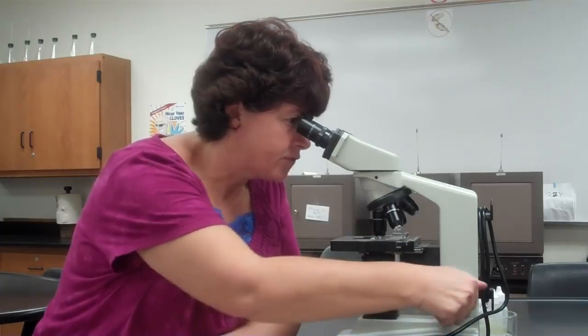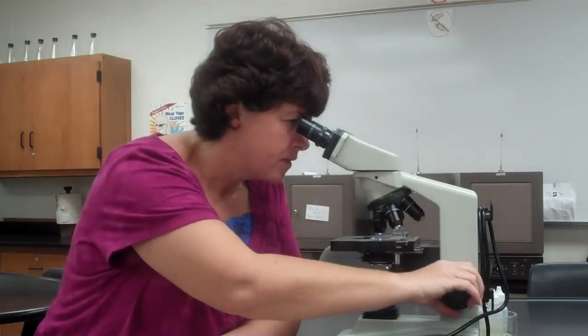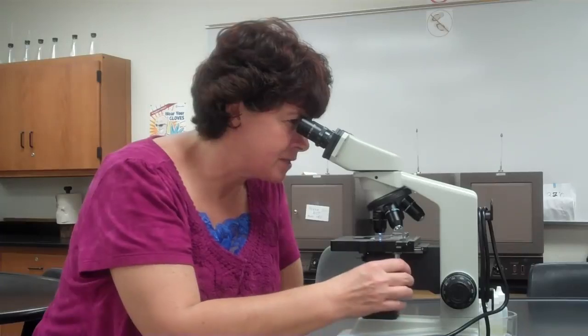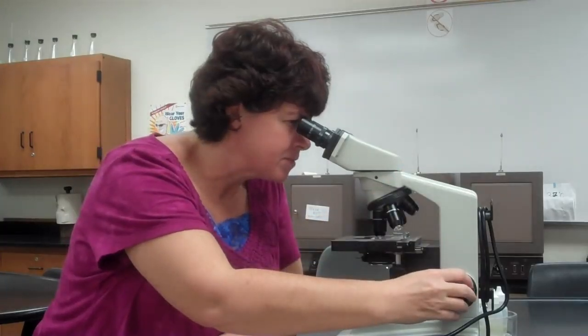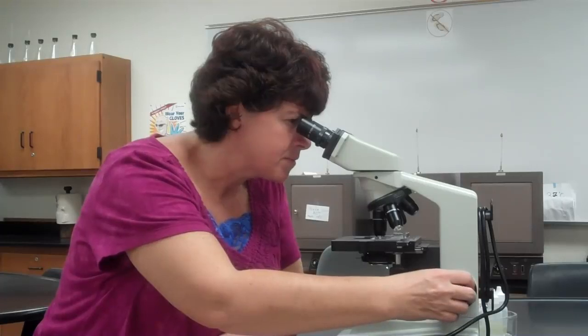If you feel like you're just focusing and focusing, take a step back. Go back to the 10, readjust. Some things that can happen is you may not have it centered, okay? Make sure that you're centered right in the middle of the specimen, okay? So now I'm going to go back to the 40. Oh, I see it. It's a little bit blurry, but I see it. So I'm going to focus. Okay, going away didn't work, so I'm going to come forward.